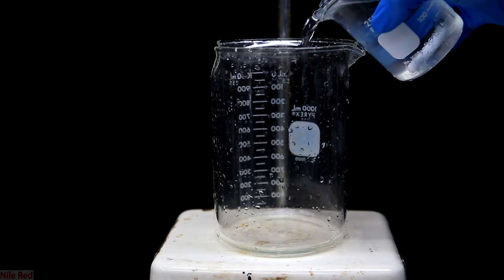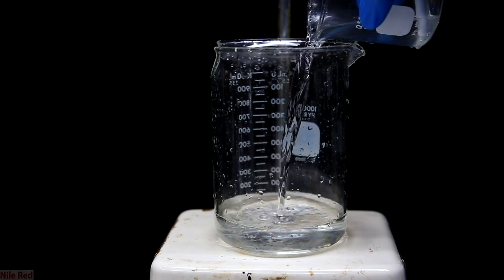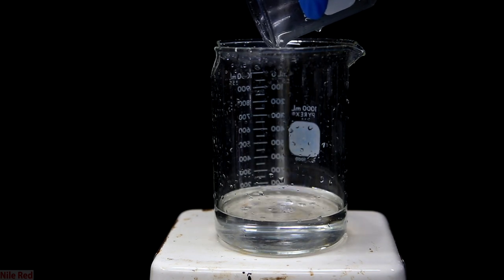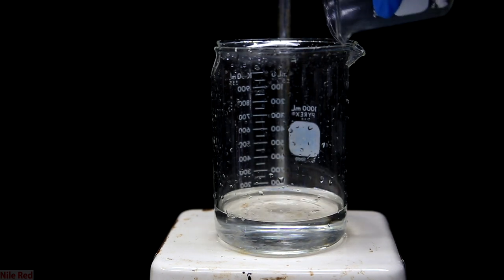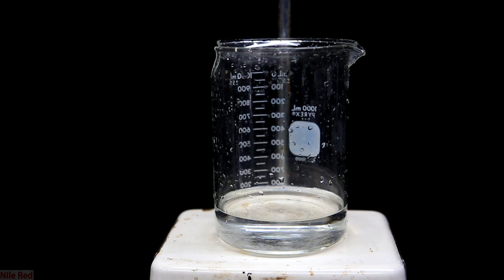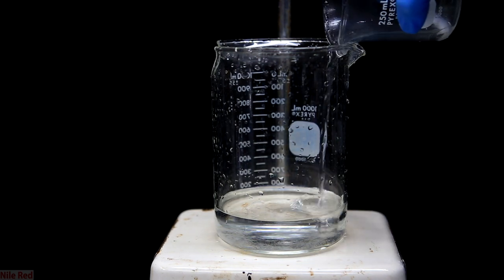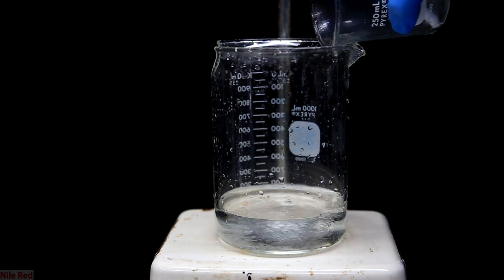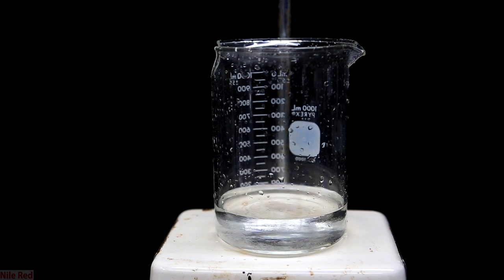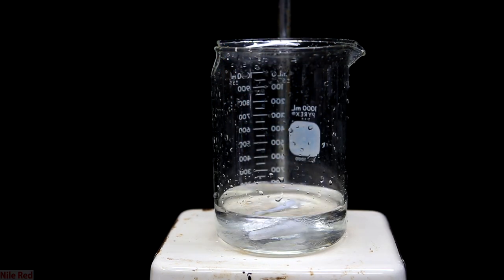Now we have to boil away the water to reduce the volume, so to do this I transfer it to a larger beaker. Like I said earlier, it's better just to start with a larger beaker. The other beaker is washed with a little bit of distilled water just to clean out any ammonium formate that might be left behind. I then put in a large stir bar and we're ready to go.